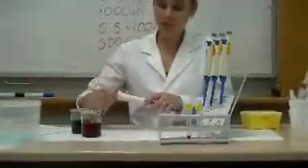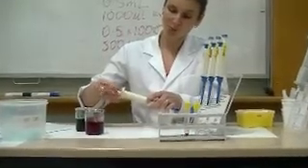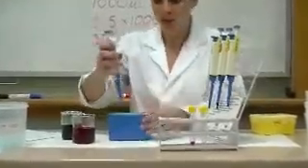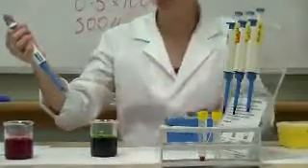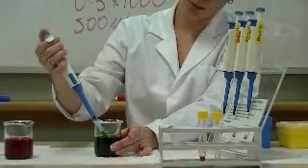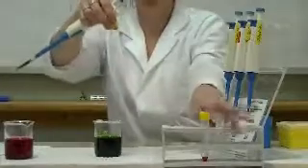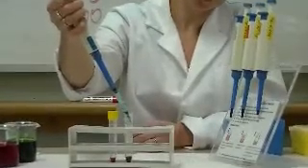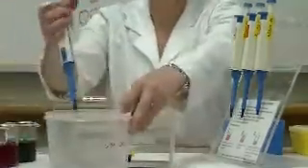So let's repeat that with 1,000 microlitres, just so that we can see the difference in volume. So I need to select 1,000 microlitres, which of course is the equivalent of 1 ml, and I need to attach a tip, and we'll use green solution this time. So I depress the plunger to the first stop, immerse the tip, slowly and steadily allow the solution in. And we'll get my tube ready. Tip on the side of the tube, slowly and steadily to the first stop and then all the way to the second stop. And I can dispose of my tip.